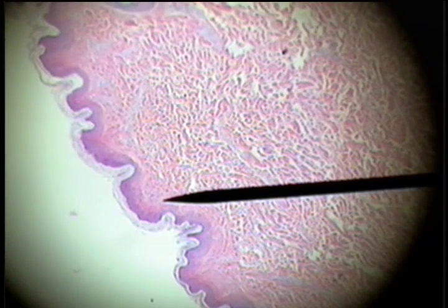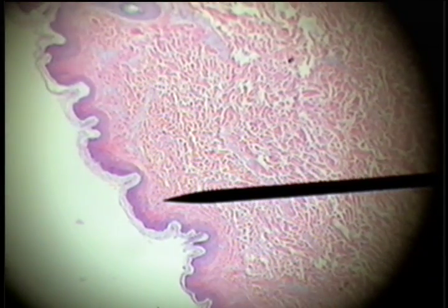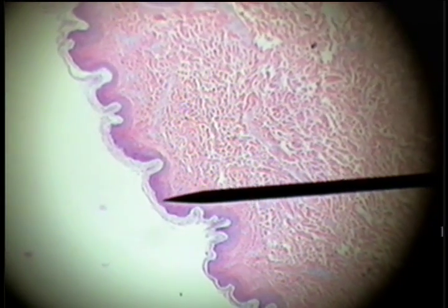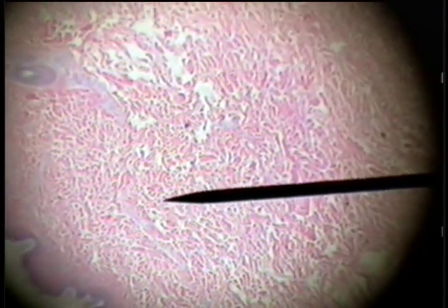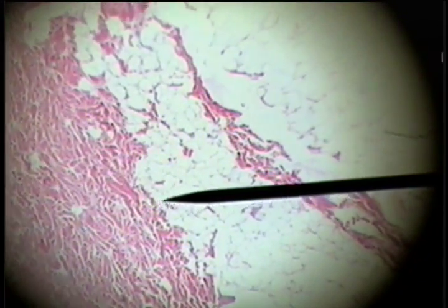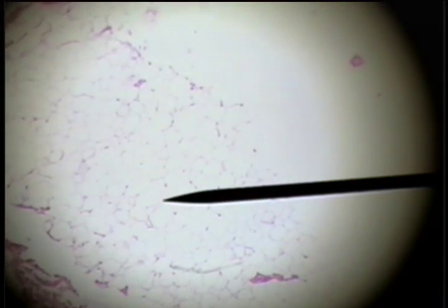This slide shows dense, irregular connective tissue. It's found in the middle layer of the skin. Here's the epidermis of the skin, here's the dermis of the skin, and then this layer with much adipose or fatty tissue is the hypodermis of the skin.